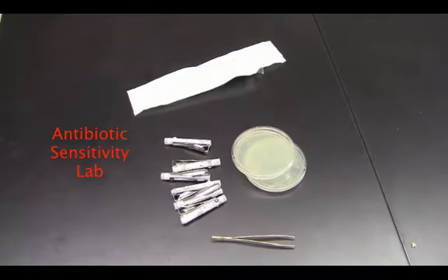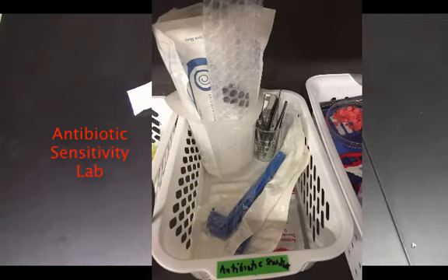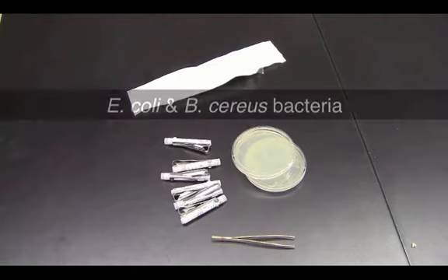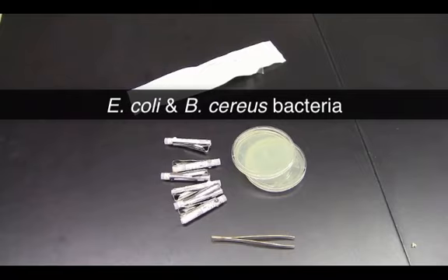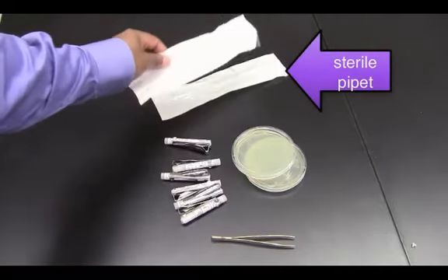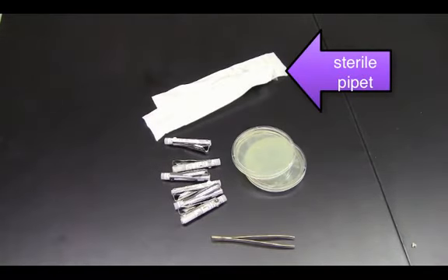Hey gang, this Labcast is about the antibiotic sensitivity lab. In this lab, what we're looking for is the effect of different antibiotics on bacteria, on two different strains of bacteria, E. coli and B. cereus. So some of the materials, of course, we have our sterile pipettes that we use for the bacteria solution.